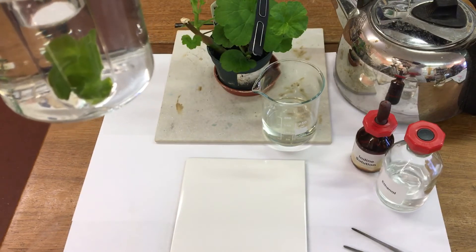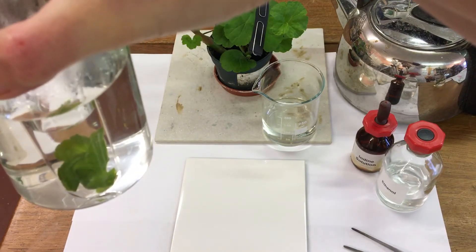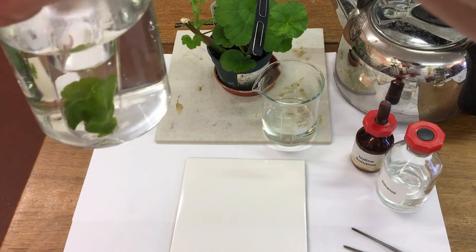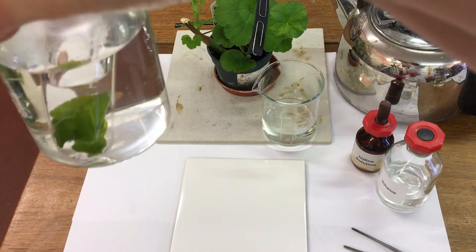So you can see the ethanol in the tube. It's starting to boil. And we're going to leave this for about 10 minutes.